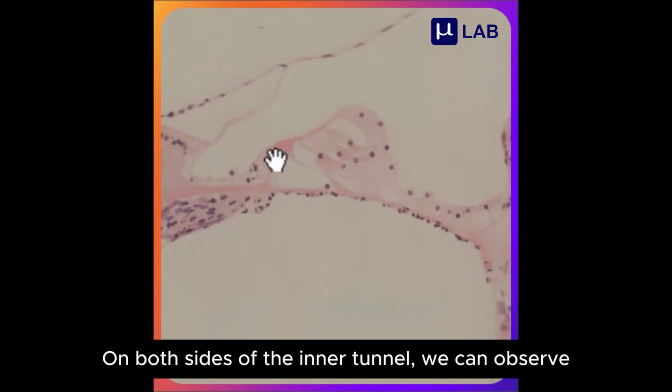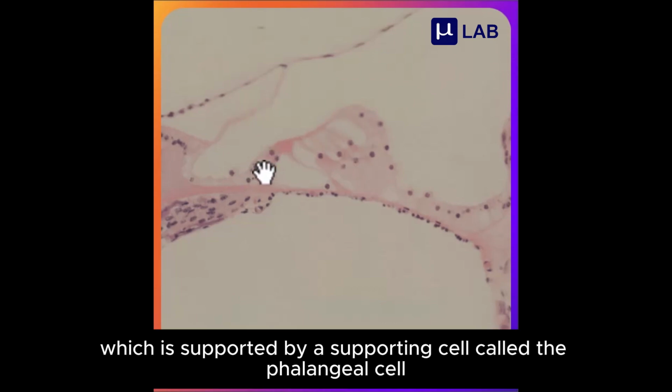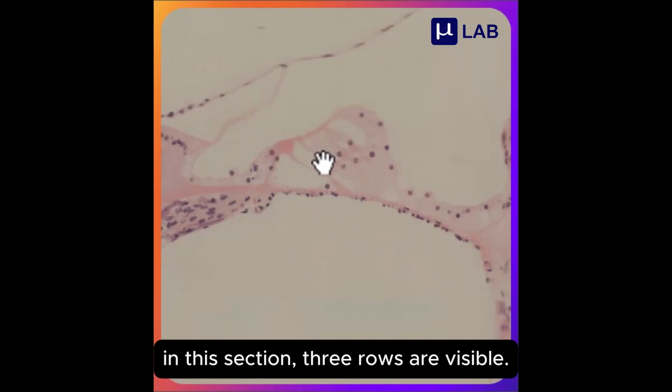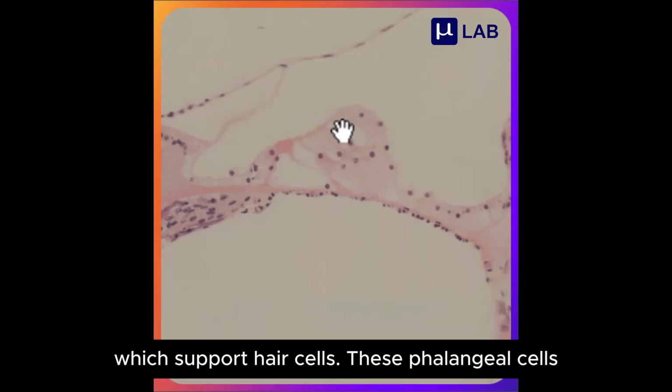On both sides of the inner tunnel, we can observe rows of inner and outer hair cells. The inner row consists of a single row, which is supported by a supporting cell called the phalangeal cell. The phalangeal cell is also a supporting cell that supports the inner hair cell. On the outer side, you can see 3 to 5 rows of outer hair cells. In this section, 3 rows are visible. The nuclei seen here belong to the phalangeal cells of the outer hair cells, which support hair cells.